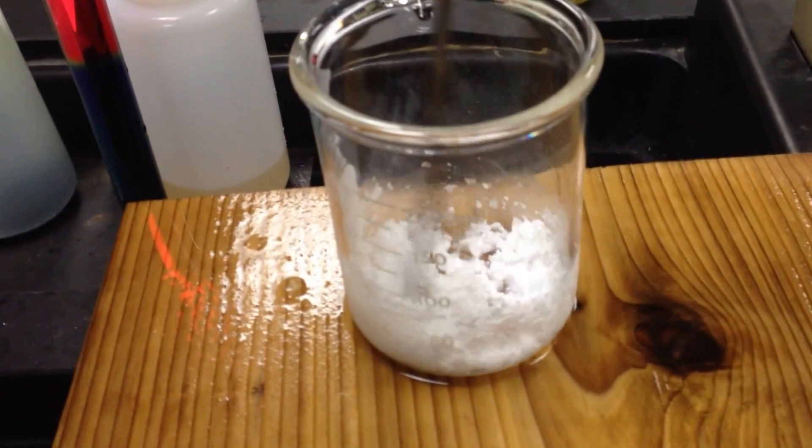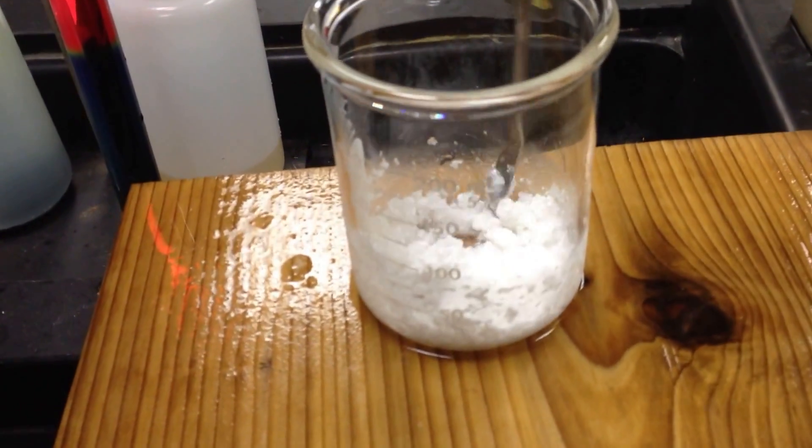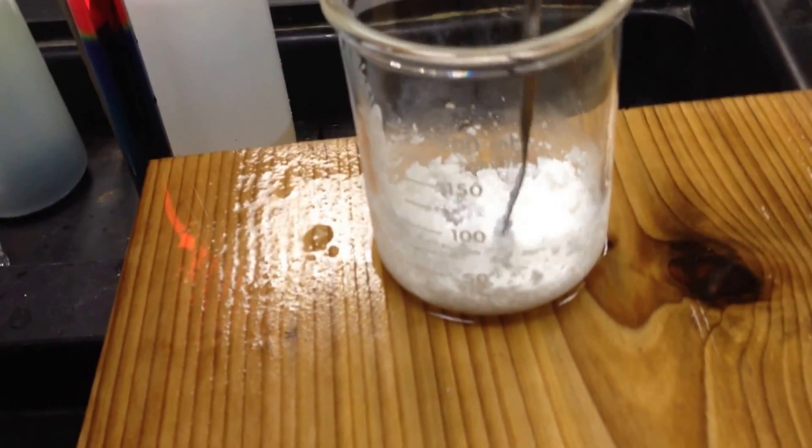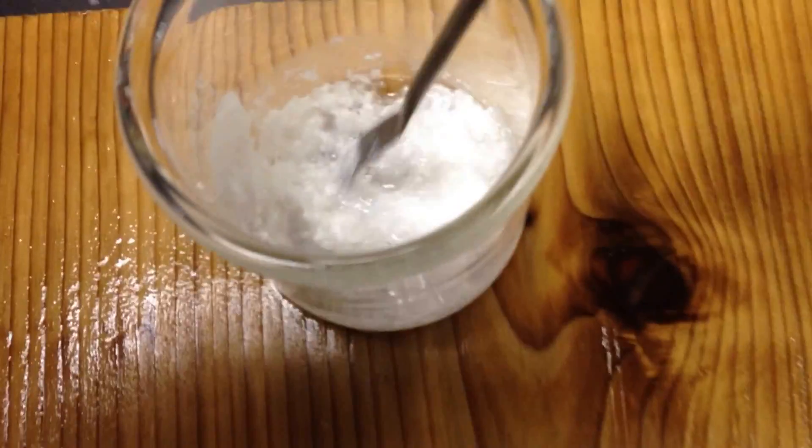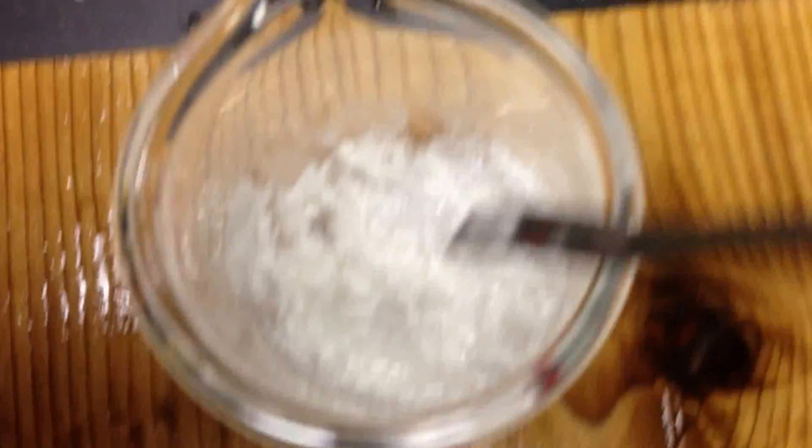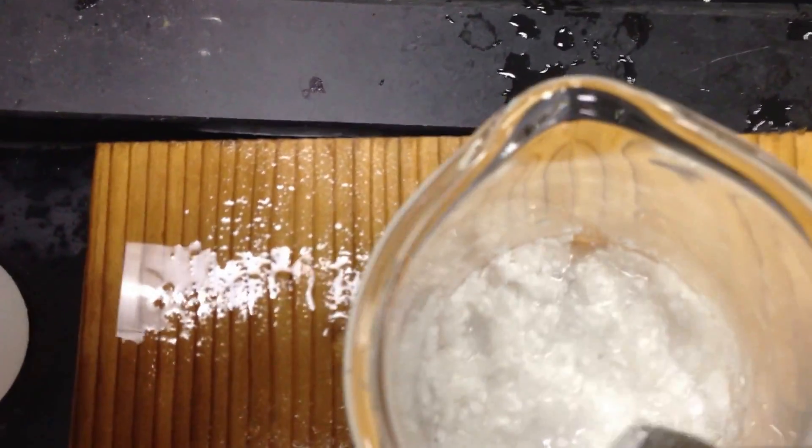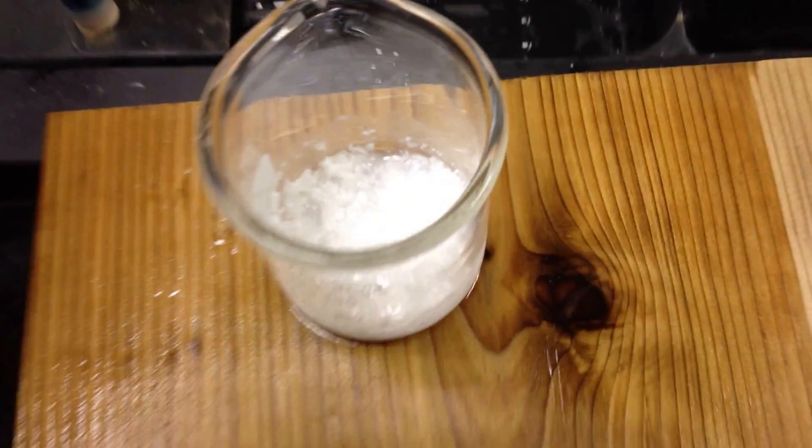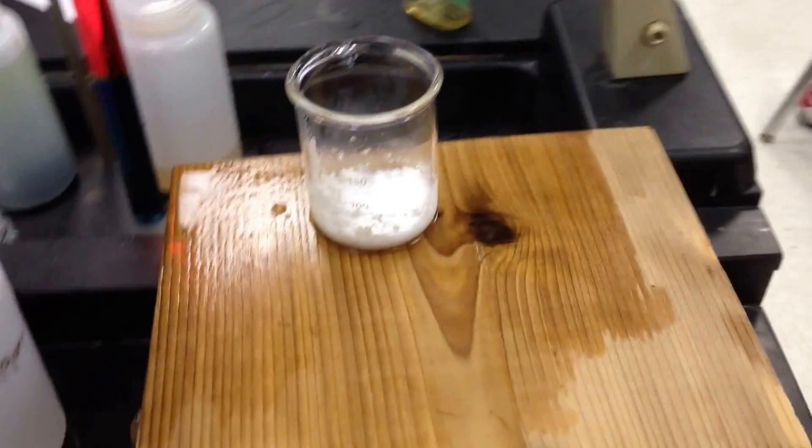For those that can't smell, you can't smell the ammonia. This is clearly mushy. Now we got what kind of, like a paste. Like a slurry. Everyone see that? So now. That was my endothermic reaction.